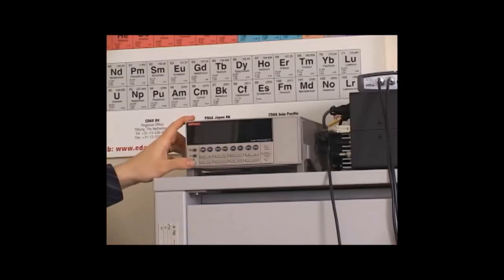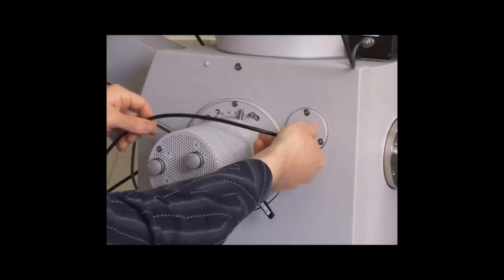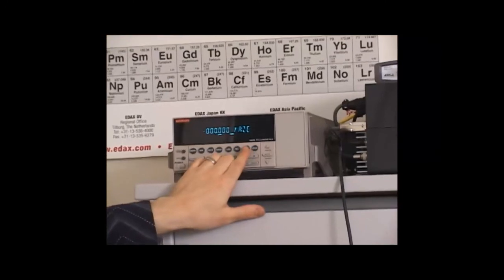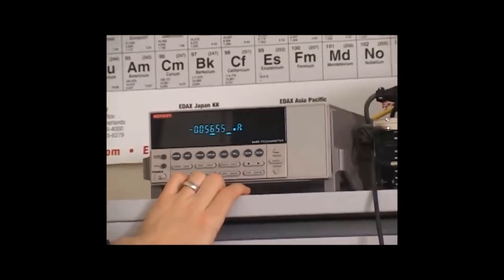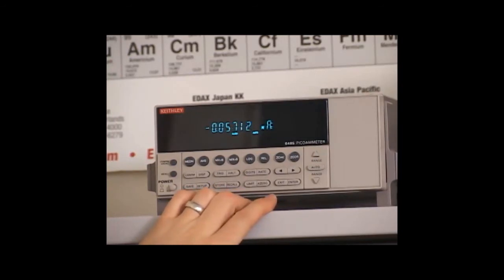To prepare the microscope for e-beam lithography, we need to connect the ammeter to the port on the front of the SEM chamber door and connect the NPGS cable bundle from the CPU to the microscope control boards. This ammeter is connected to the BNC port on the SEM chamber, and it's going to measure the amount of current coming through the beam. I'm just going to change it to nanoamps.